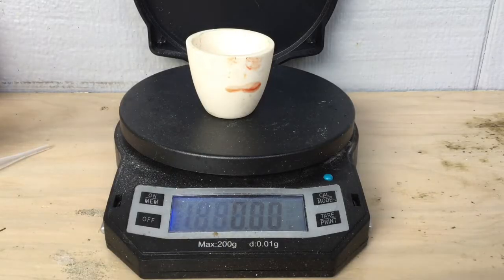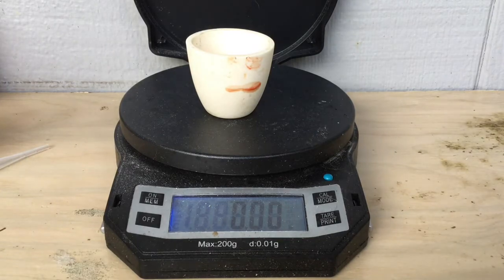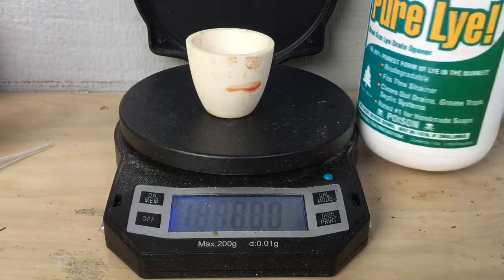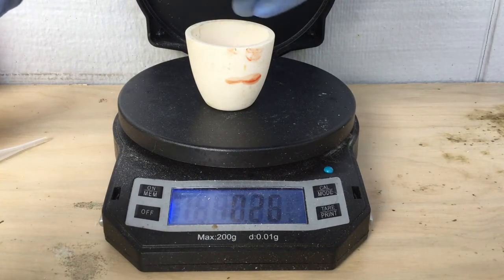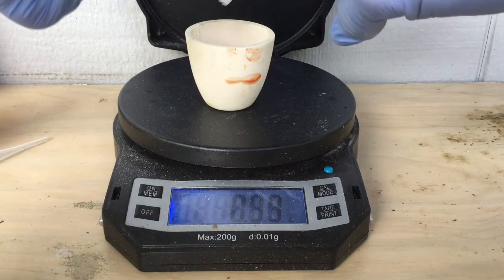Hey everybody, welcome back to Back Maxi with your host Mac, myself. Today we're going to be doing a titration of my old sulfuric acid because I need to know what its concentration is.